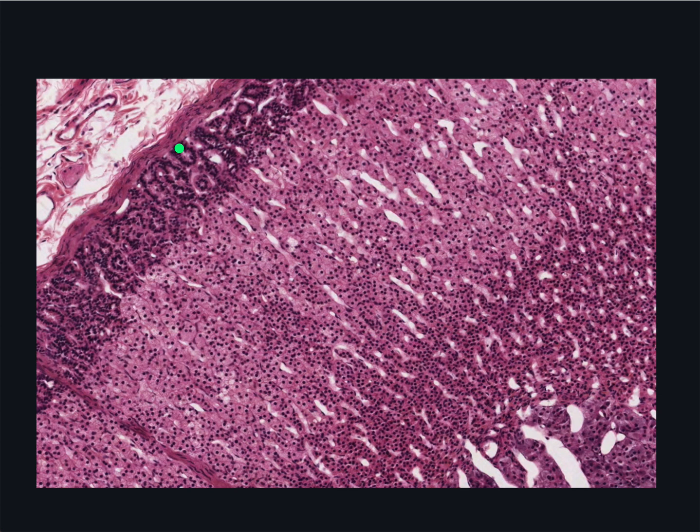The layers of the cortex can be visually distinguished in two ways. One is by the orientation of the columns of cells, and therefore the capillaries that lie between them. In the outer zona glomerulosa, the cells are arranged in curled columns. The columns then straighten out into almost perfectly radial alignments in the zona fasciculata. And then, once again, they become more disorganised in the zona reticularis.